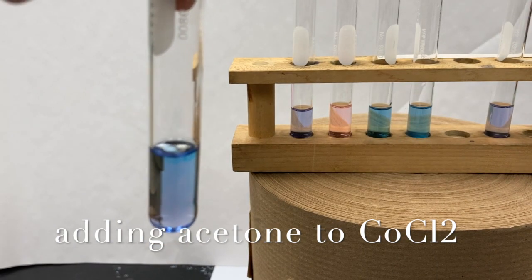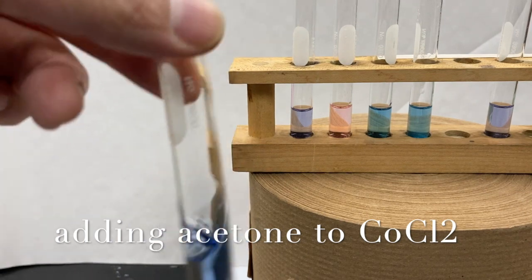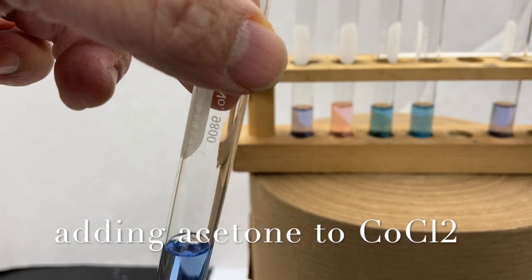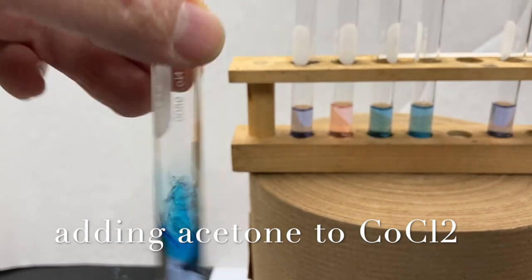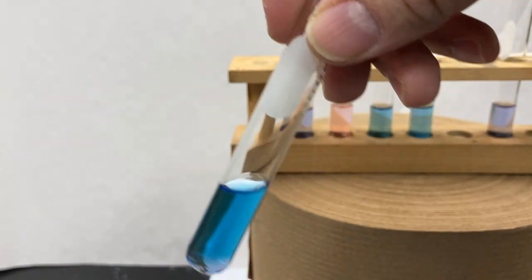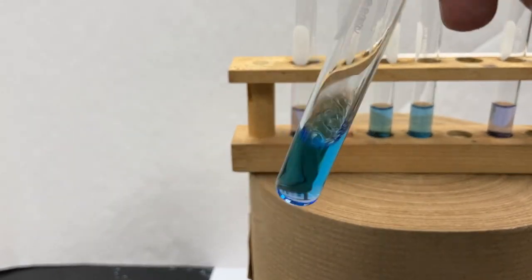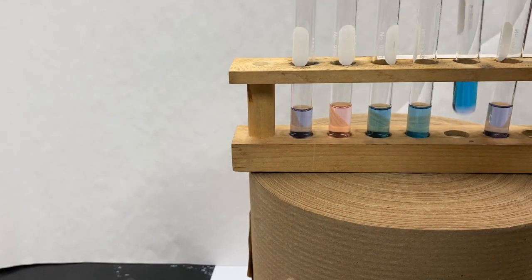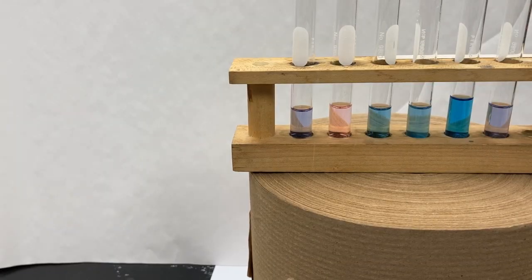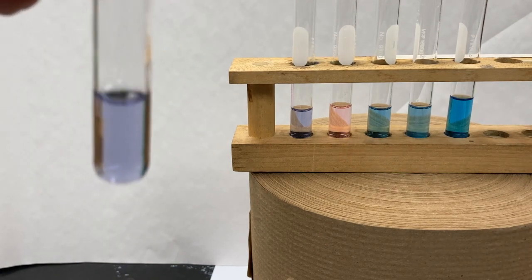So initially we get this blue color. Add a little bit more. Yep, definitely get a blue, nice translucent blue again. And to our last tube, tube F, we're gonna add some silver nitrate.